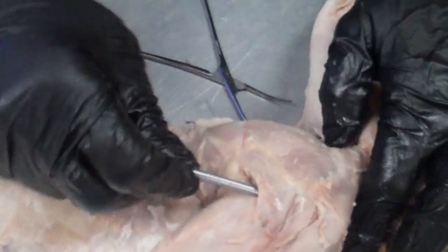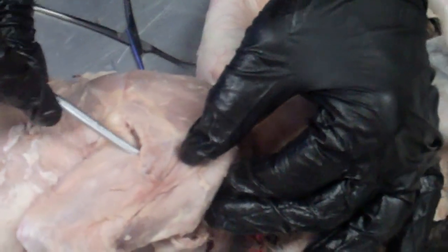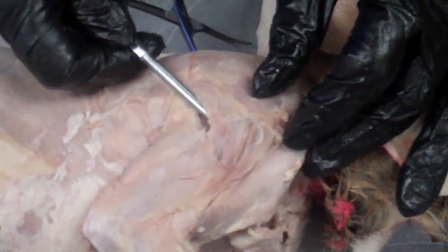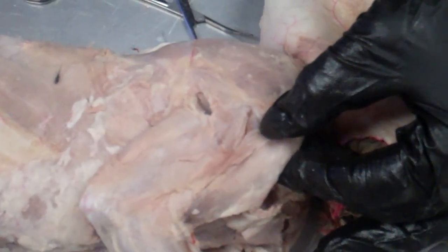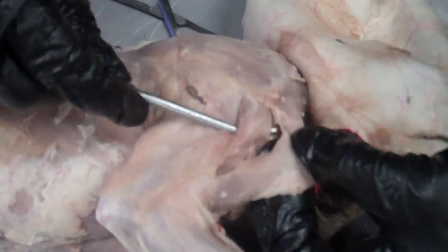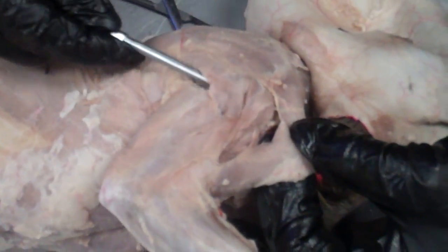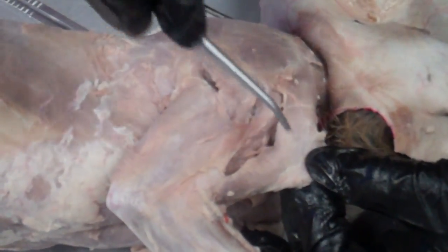As I pull this over here, I'm going to separate this muscle. This is the spinal deltoid, and I should be able to get underneath here and separate it from the acromial deltoid. So the three deltoids are the clavodeltoid, the acromial deltoid, and the spinal deltoid — you need to be able to get underneath all three of those muscles.